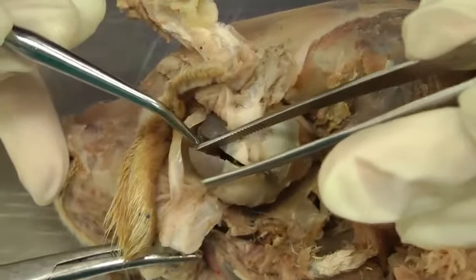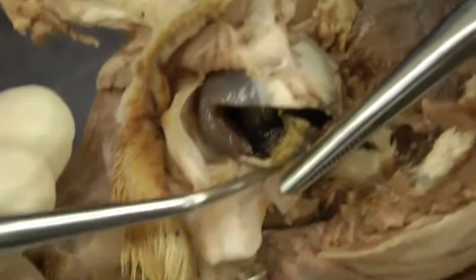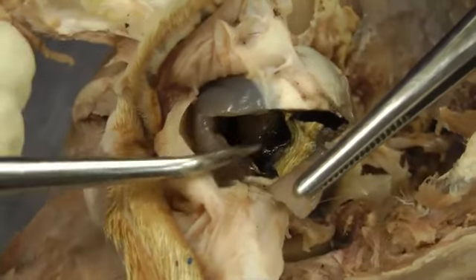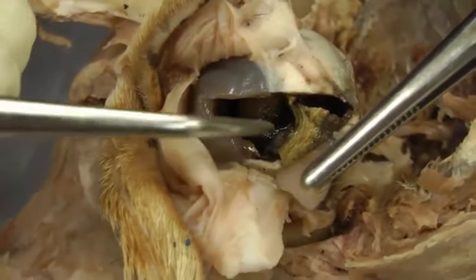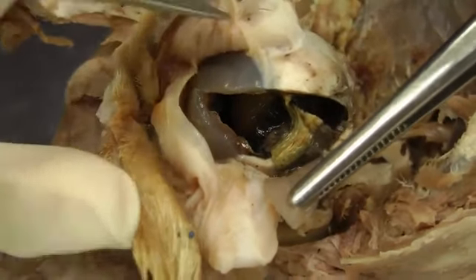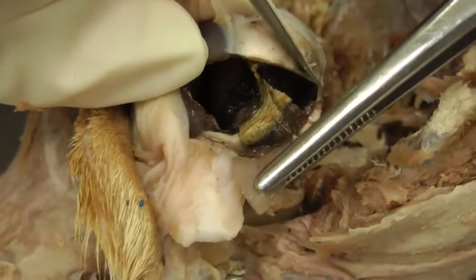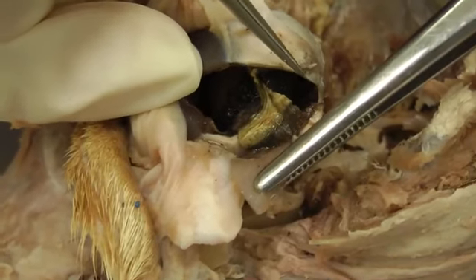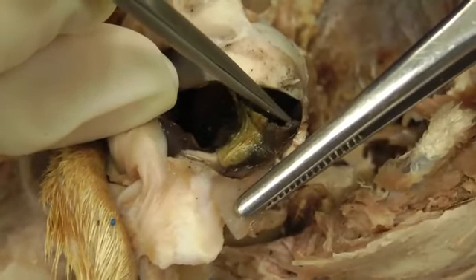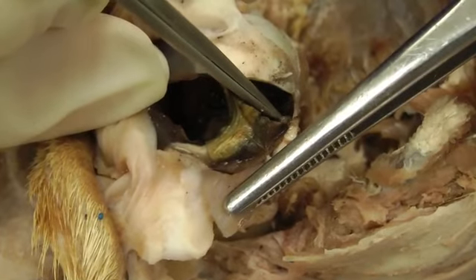And then when we cut it open and we open it up here, we can see a few of the internal structures that are part of the middle vascular coat. So here we have the iris, the colored part of the eye, and the hole in the middle of the iris would be the pupil. And then the choroid is the continuation of that vascular coat. It's going to be this black line you see right here, the choroid extending back. Then you would have the ciliary body, which is just behind the iris, in between the iris and the choroid, this little nub right here.